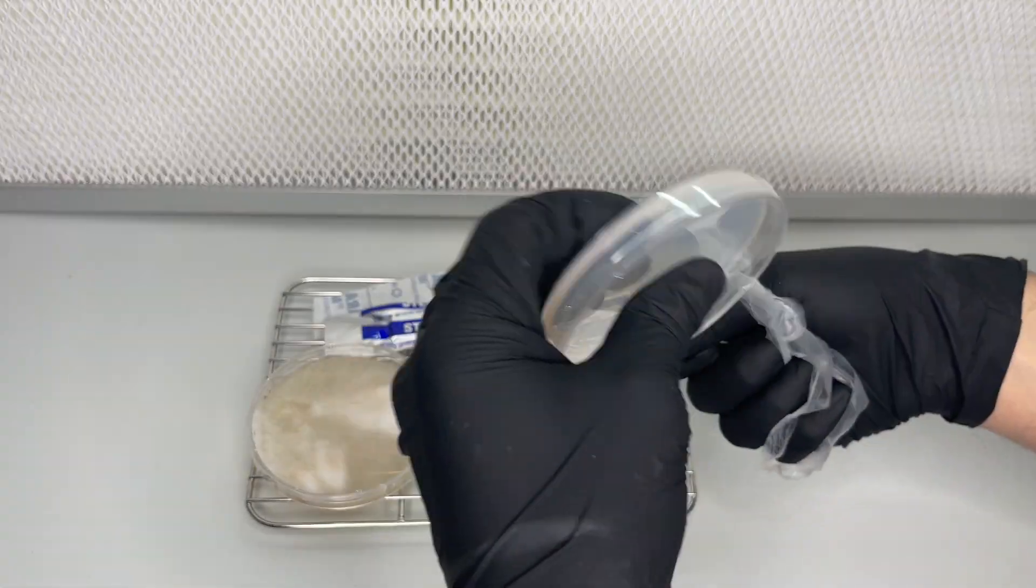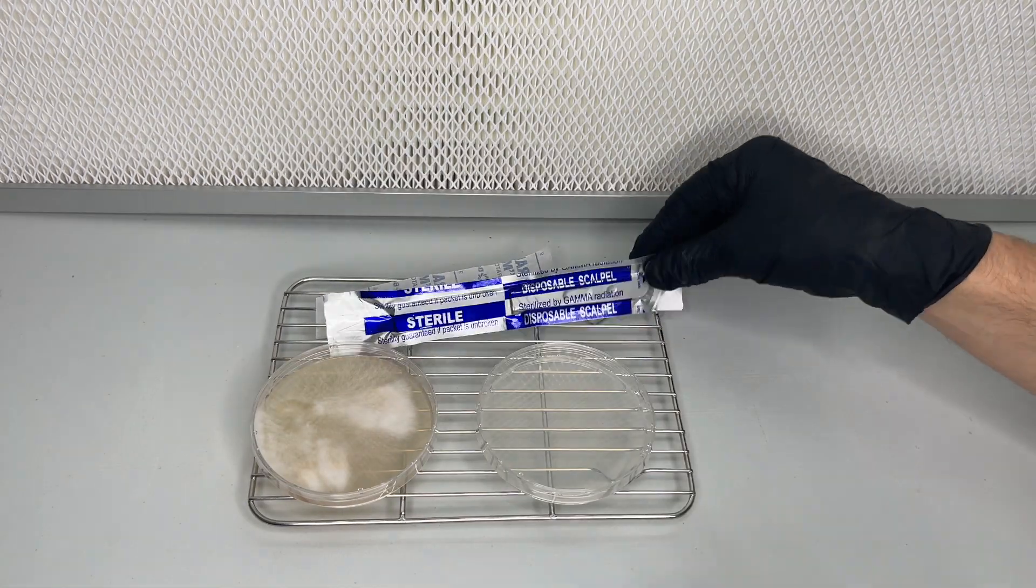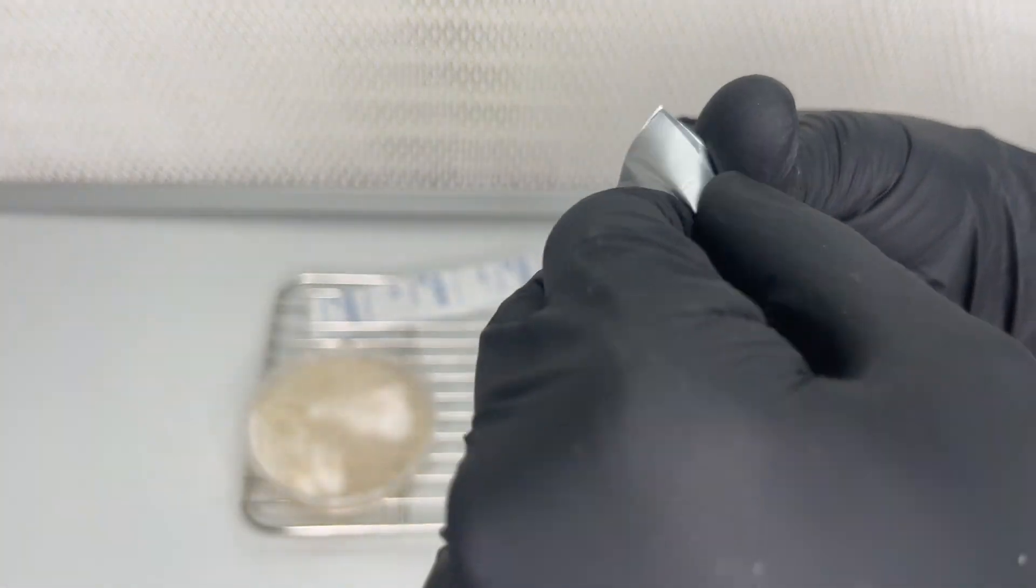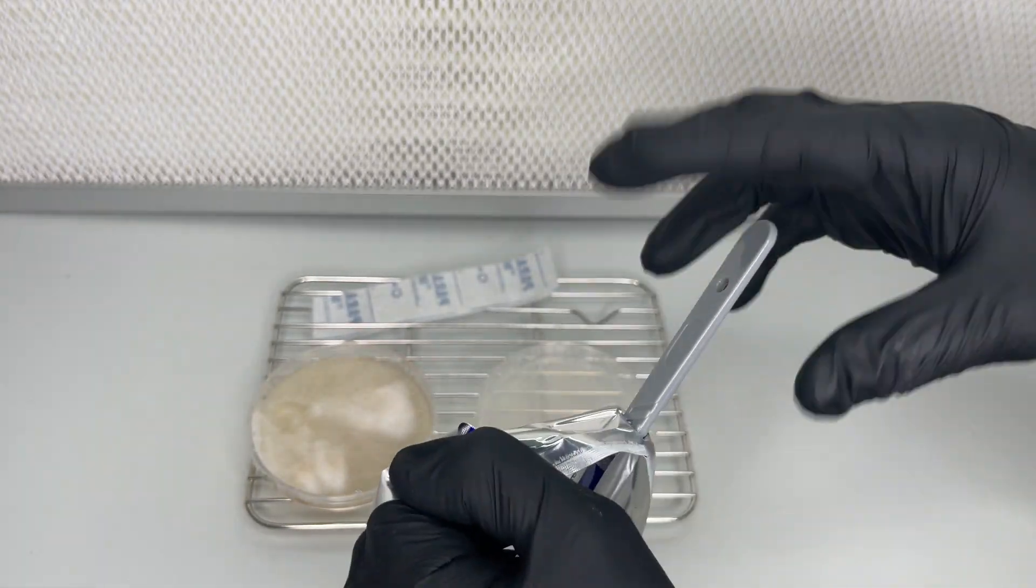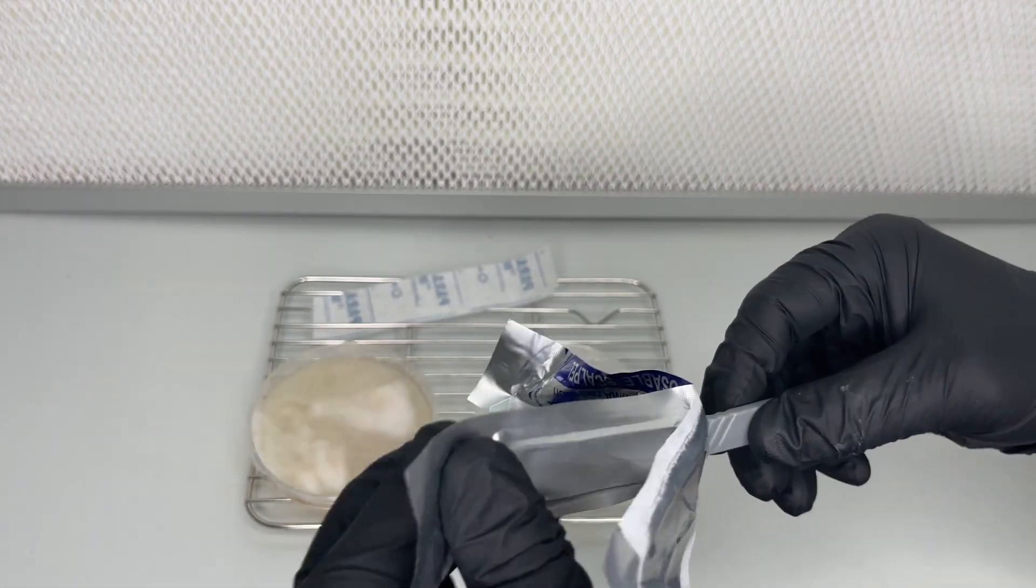The water agar doesn't have any nutrients in it, so the bacteria will not grow but the mycelium will. I use a sterile scalpel to transfer a piece from the cleanest section I can find over to the water agar plate.